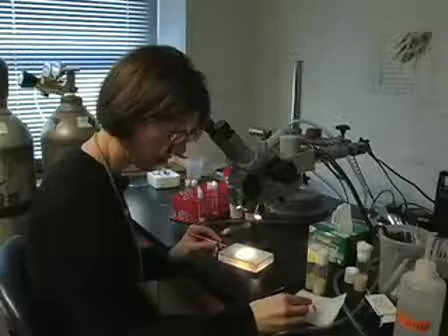During that time, we apply paint to the back of the abdomens of the flies so we can identify them. And now we're making chambers.